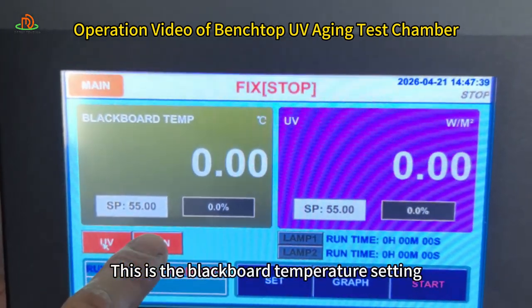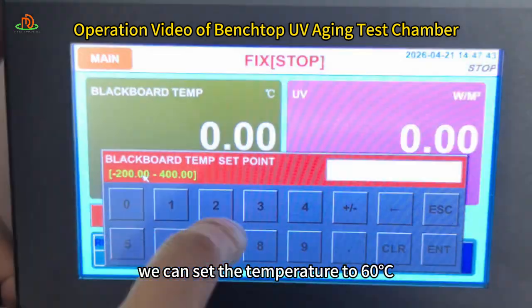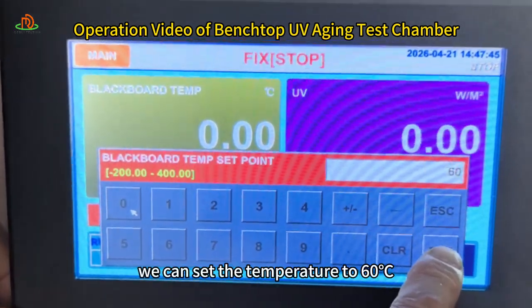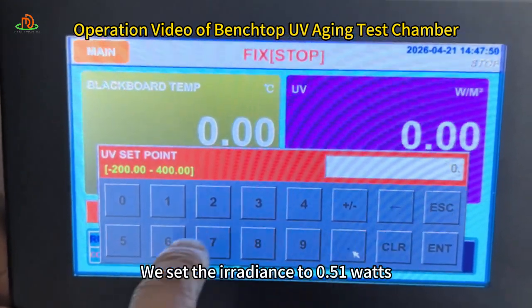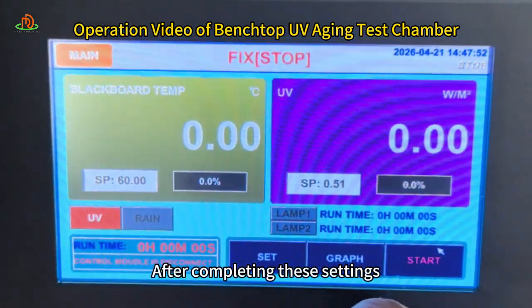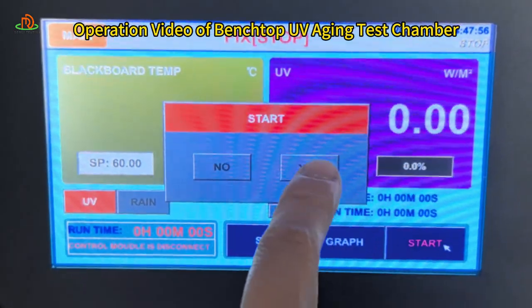This is the blackboard temperature setting. For example, we can set the temperature to 60 degrees centigrade. We set the irradiance to 0.51 watts. After completing these settings, you can click Start to run.